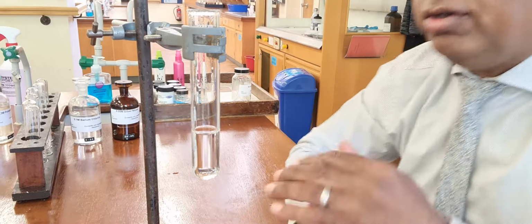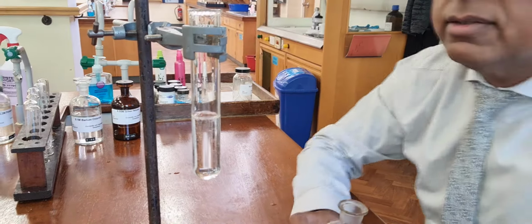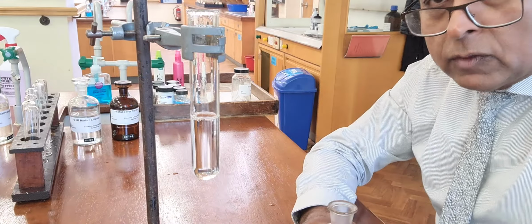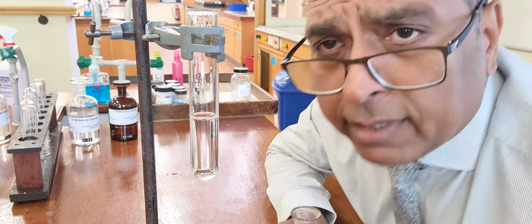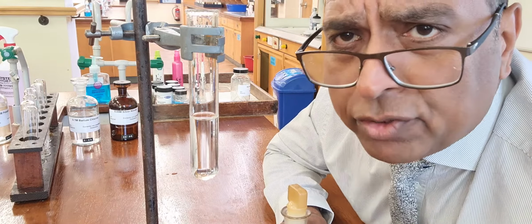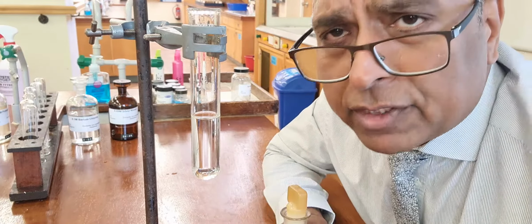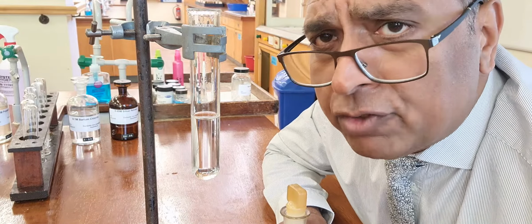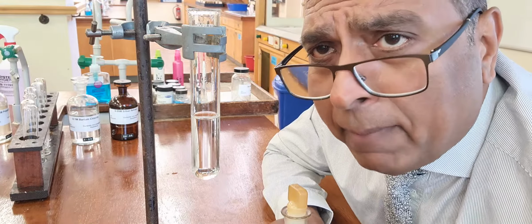To be doubly sure, you could collect the gas that came off, and bubble it through lime water. I'm not going to do that, because the main thing I want to focus on is the reaction that's happening there, the reaction that gives you carbon dioxide gas, and I'm going to deal with that when I carry on with my PowerPoint.